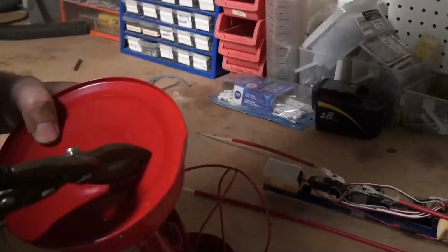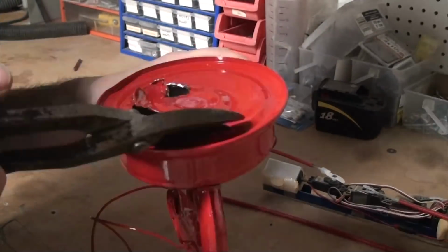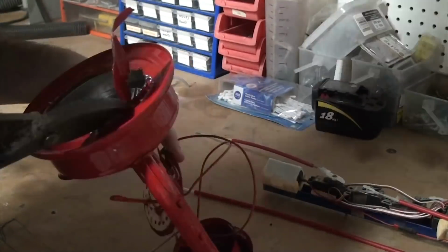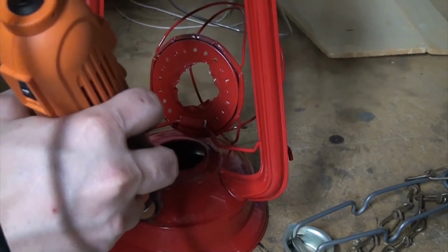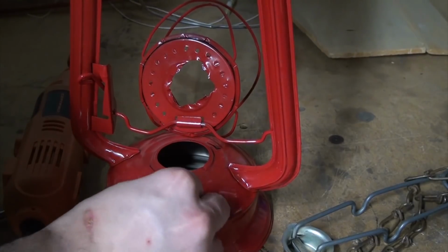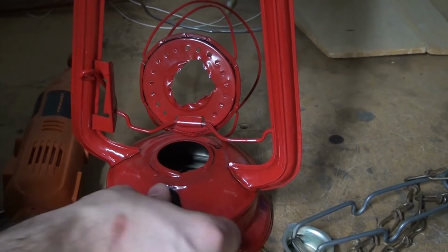While that was curing, I cut a big hole in the bottom of the lantern and removed the kerosene tank to leave lots of room for the electronics. I removed the kerosene filling cap and widened the hole to accept a nice switch, and made a second hole next to it to fit a second switch, though I didn't add these till the end.